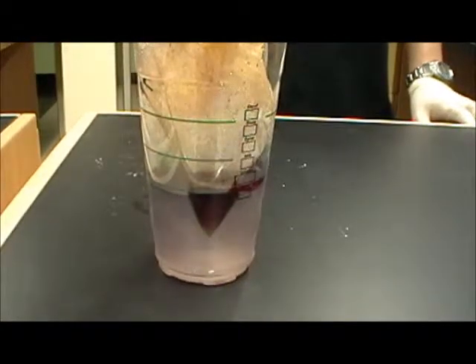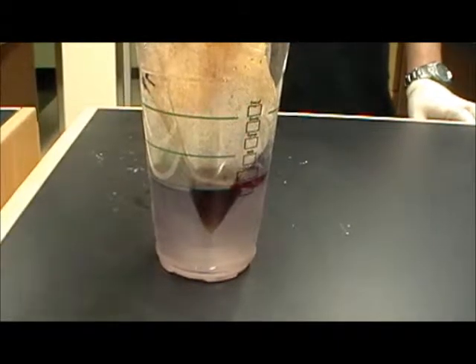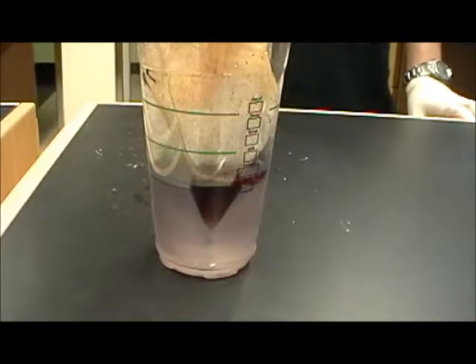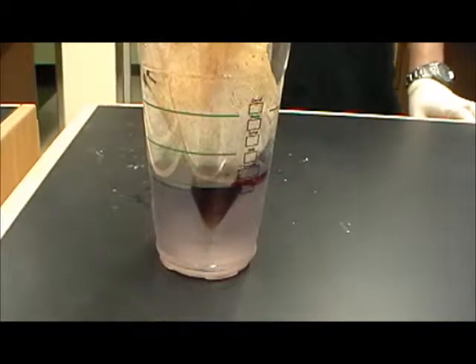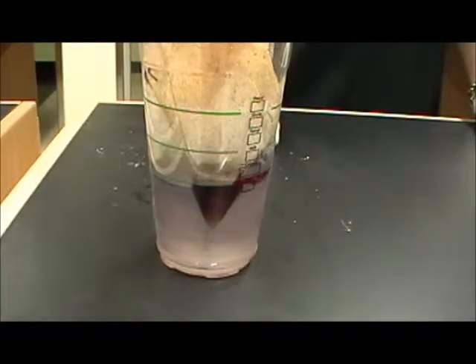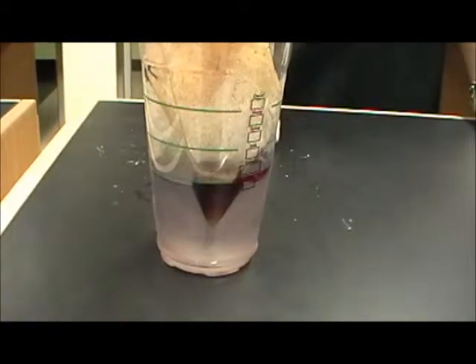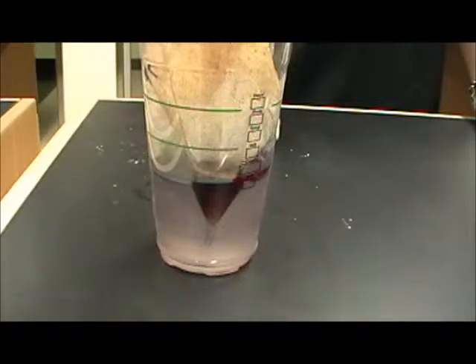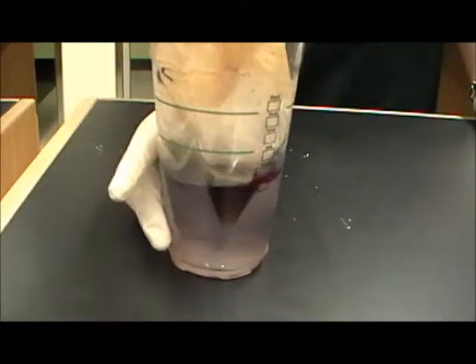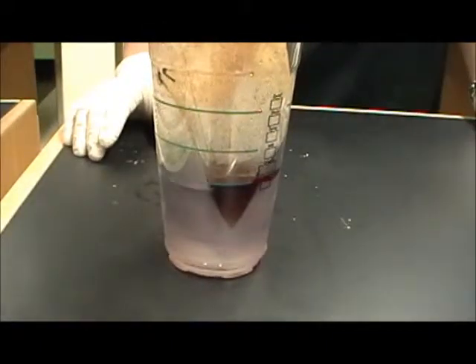So as you can see here, our starch solution is getting much more purple. The iodine and starch has been sitting together for about 15 minutes. If it takes longer than this during your class period, and if you're running out of time, feel free to have the students set this part up, and if they're not seeing a really vibrant purple color change, you can have them leave it overnight or until the next class period and then observe the final color at a later date.